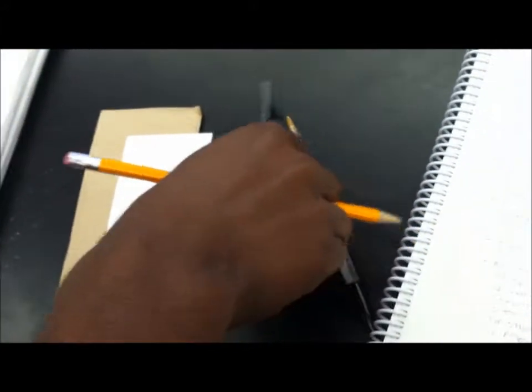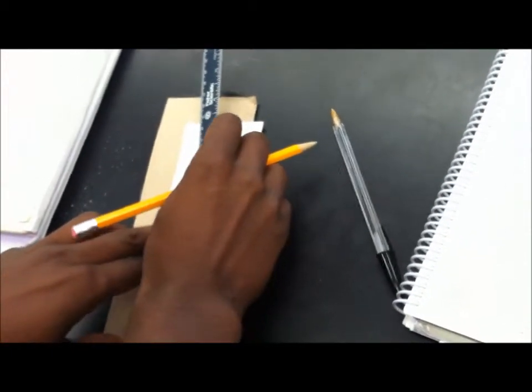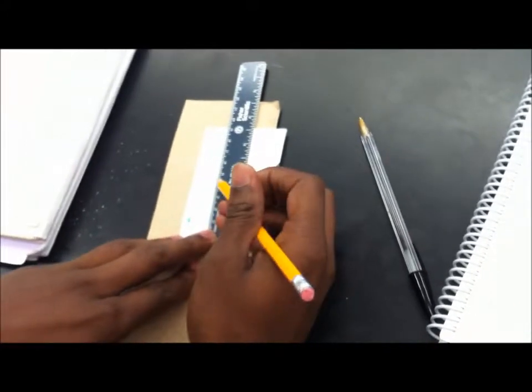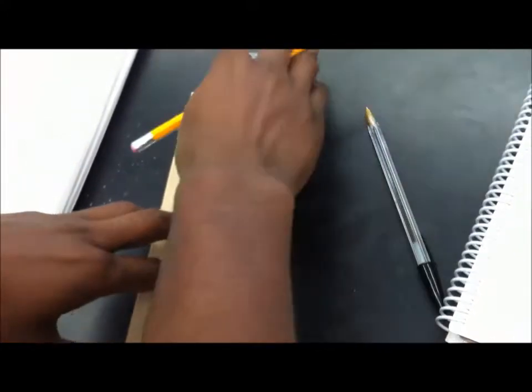All right, did that. All right, so now we're going to measure this one right here. And we're going to measure from here up and it is about four and three-fourth centimeters. So we're going to write that.